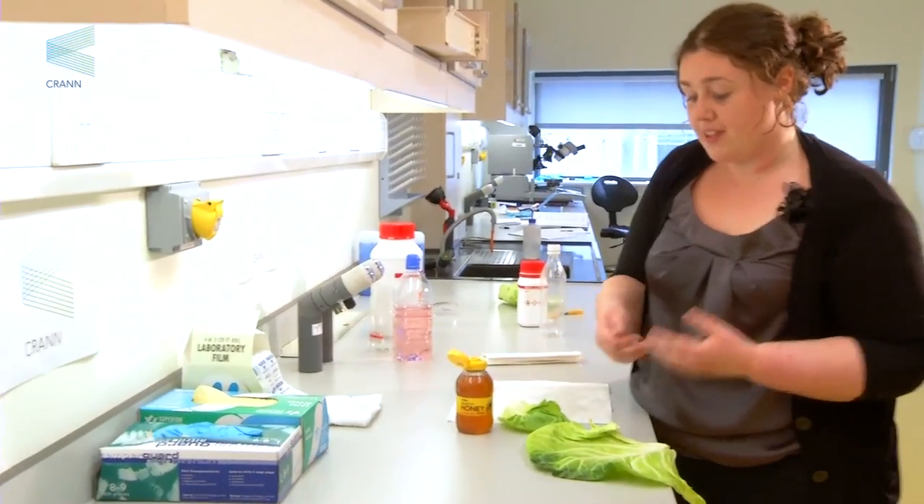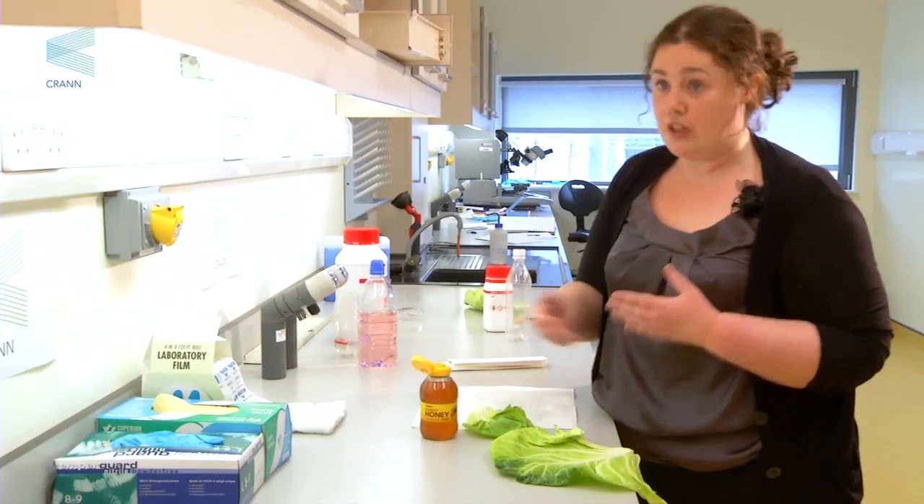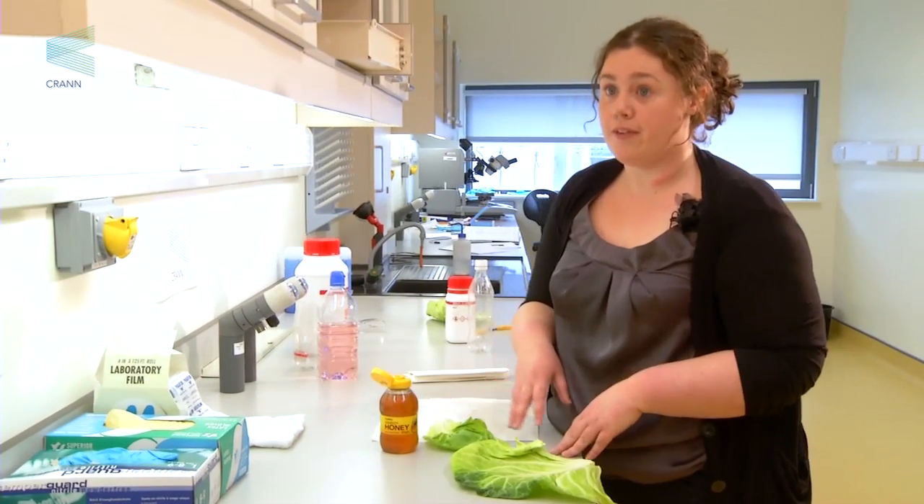So the aim of this experiment is for you to determine which one of these you think is hydrophobic, judging by what you've observed.